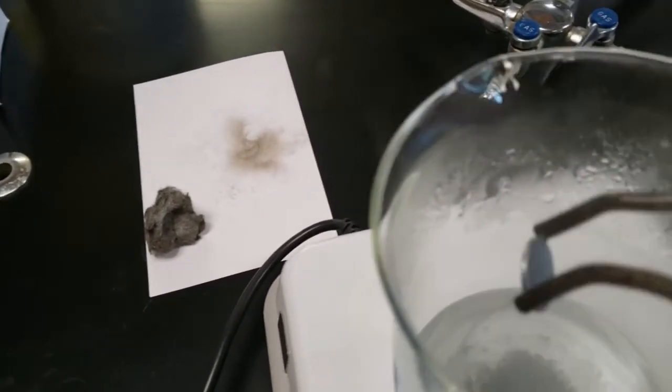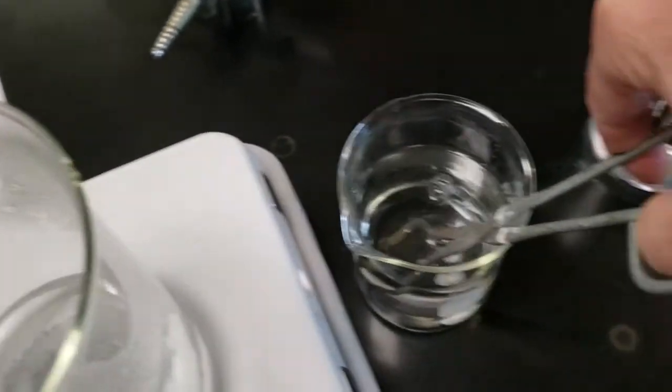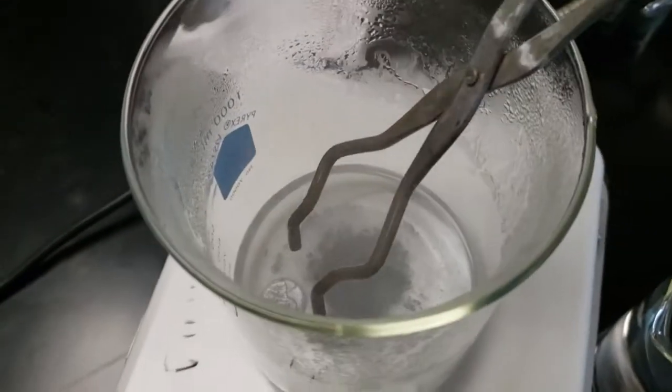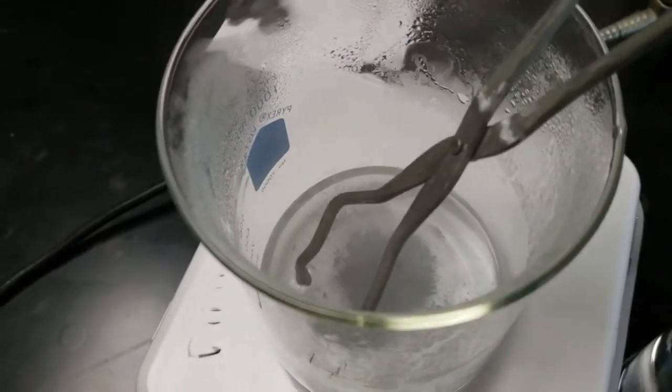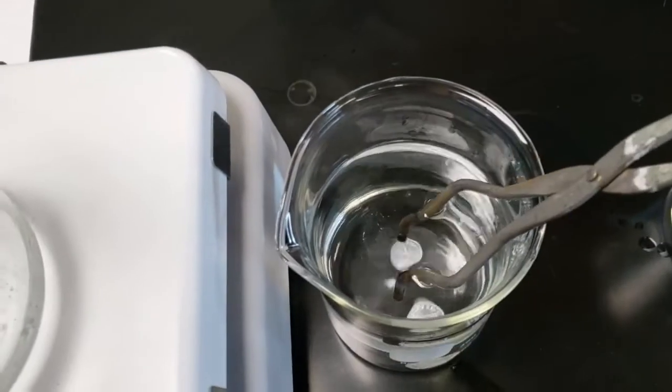Put it into the first beaker. We'll use one small beaker of water for washing and one small beaker for cooling once we heat it up, which we'll see in a minute. So try not to mix these up. This one's gonna be contaminated with some of that sodium hydroxide.